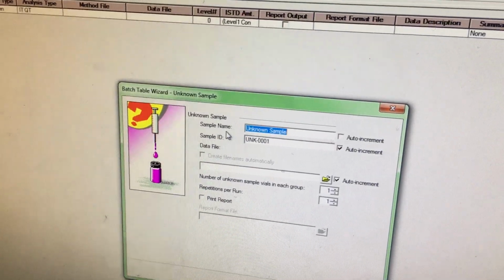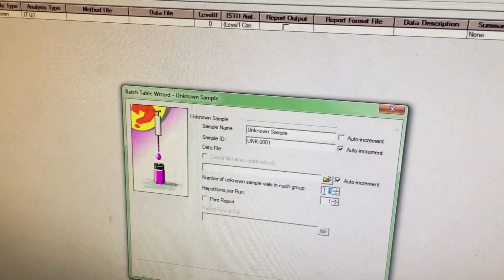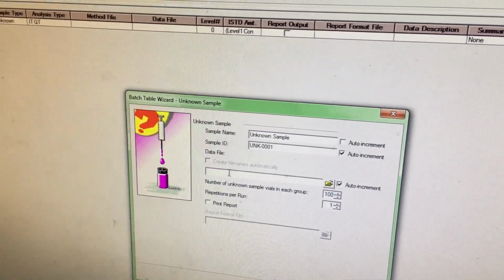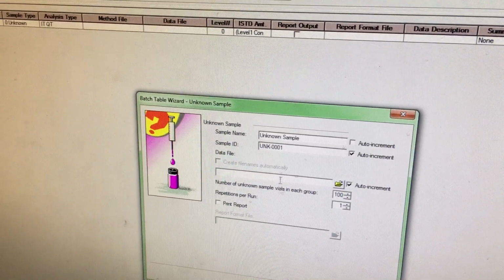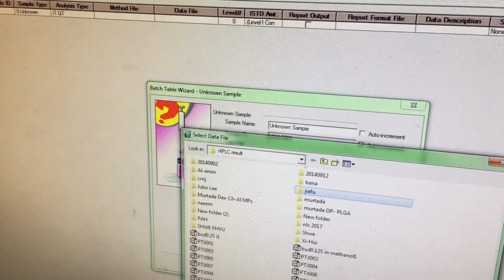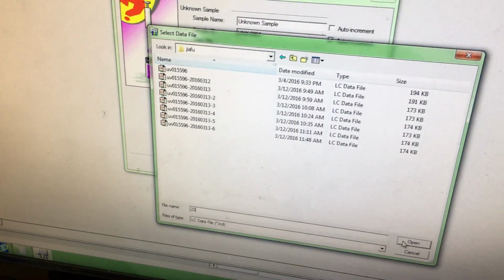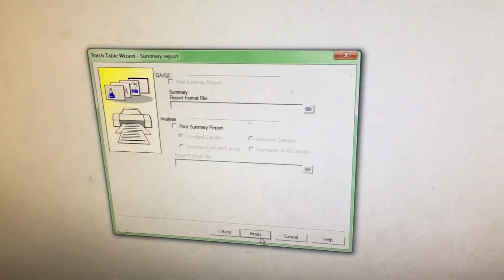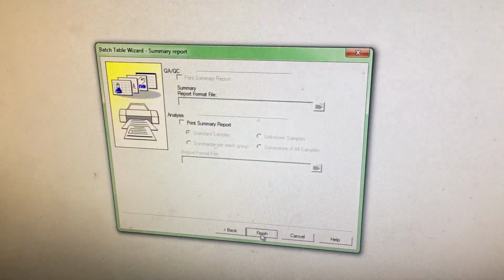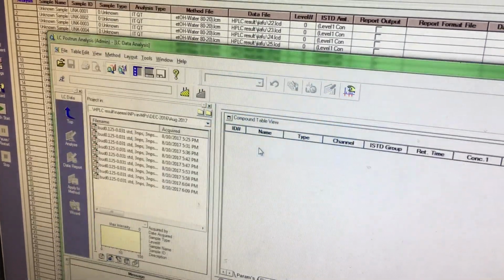Next, and then your sample name, your sample ID, the folder, and the number of samples. For example, you're using 100 samples, and here you will click folder and then next. For example, I just choose this one, and then again you choose sample, but just give any sample name, open, and then next, and then finish. Then click batch start. But I don't want to start because this is empty. So finally they will come, and similarly you will go to post run and check the result.